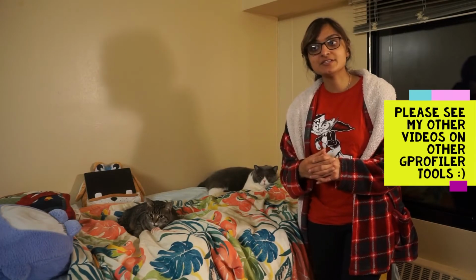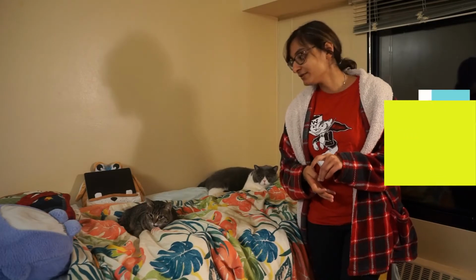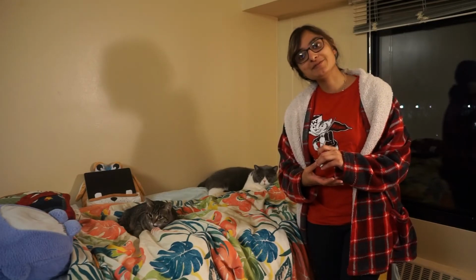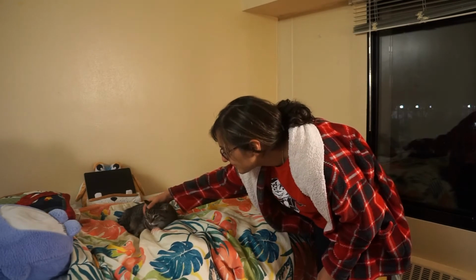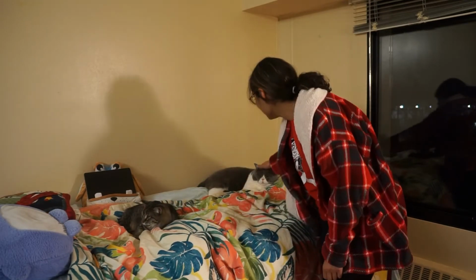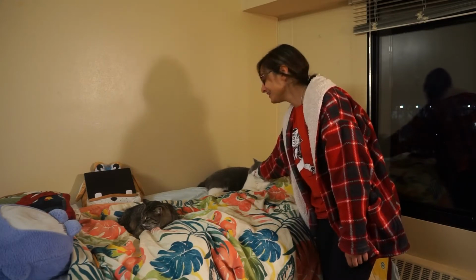There are various tools out there. I just wanted to show you a very intuitive one that I discovered that uses gProfiler that I've already talked about in other videos as well. So I hope that this will be a helpful tool for you guys to be able to convert between different species in terms of their gene names, figuring out what works and how genes in my DNA, me and Yangshi, how those are actually related to each other.